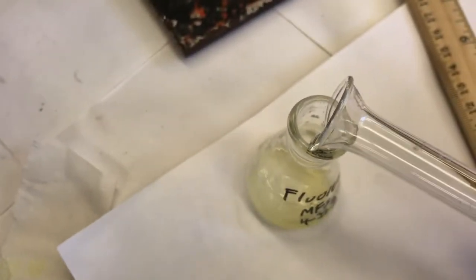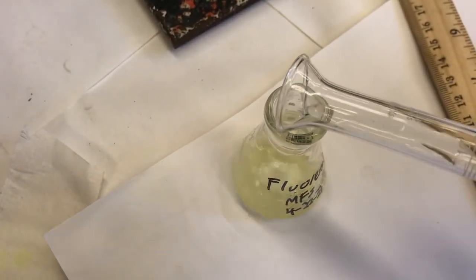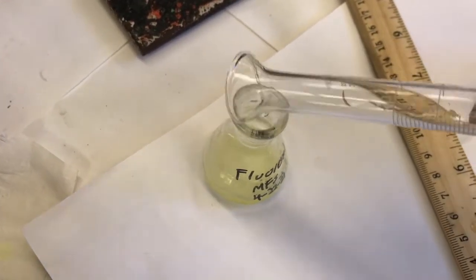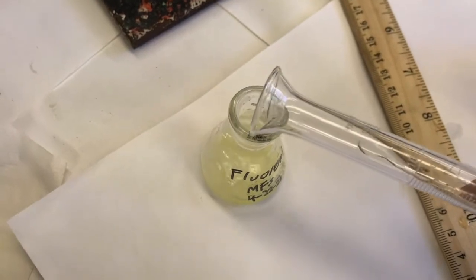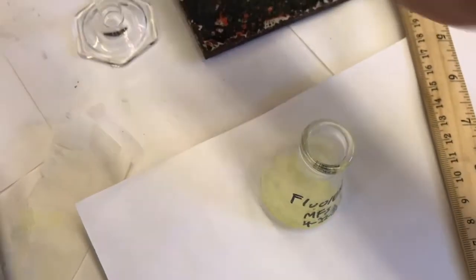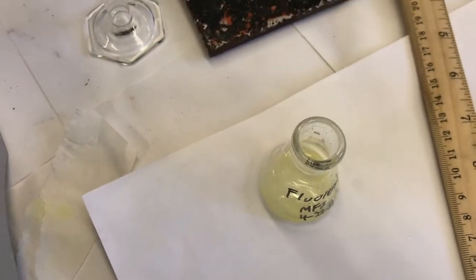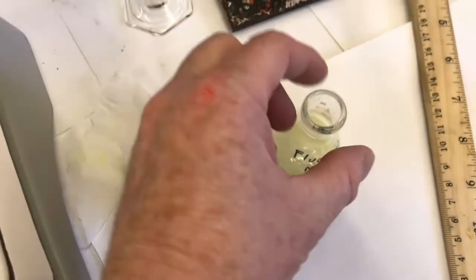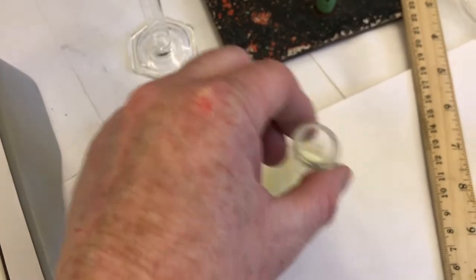And I'm gonna pour that into my reaction, and when I do that, I'm going to have no longer just methanol as my solution. I'm going to have methanol and water. And methanol and water are miscible, remember, meaning that you can dissolve any proportion of water and methanol in each other. So now I have this new solvent. It's not just methanol, it's methanol and water. And what's more polar, methanol or water?